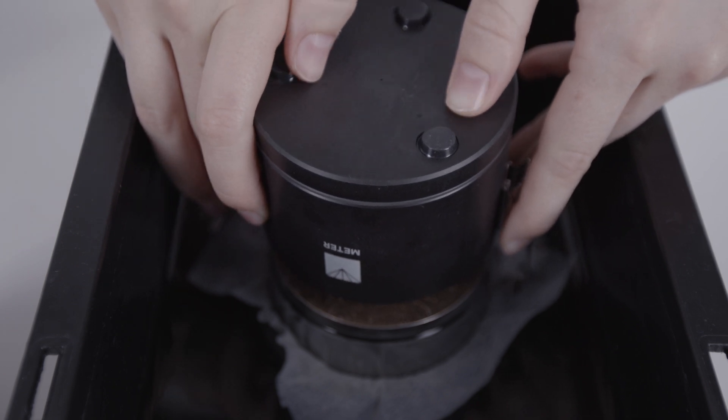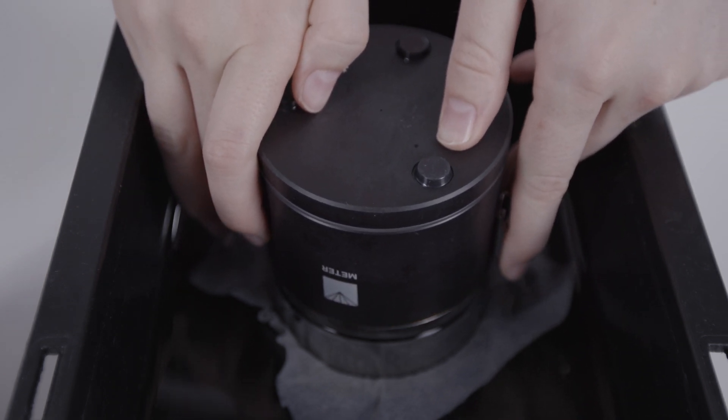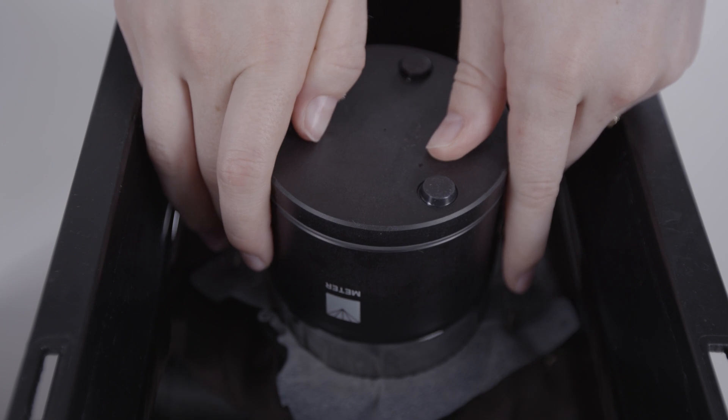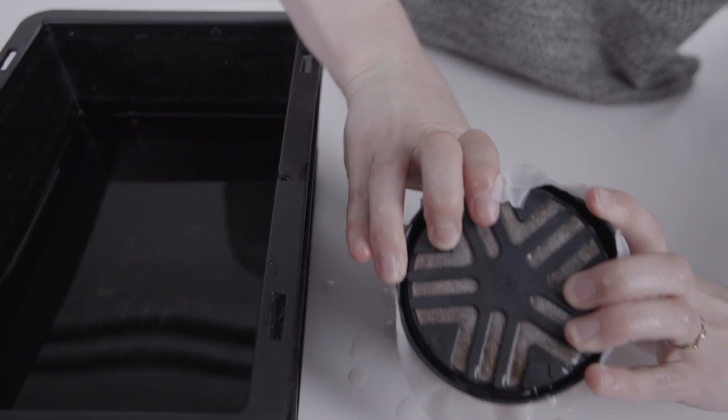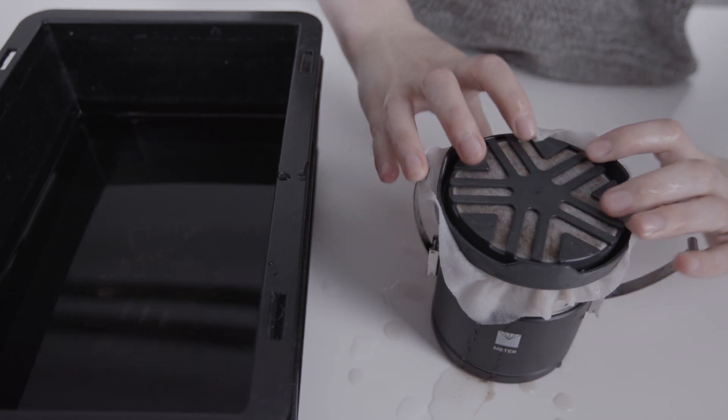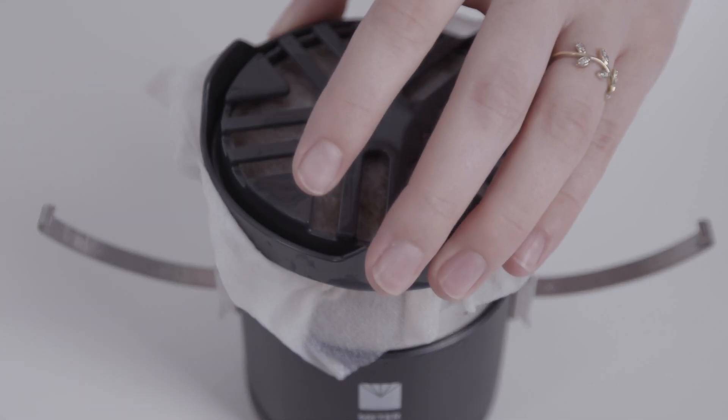Carefully place the sensor unit upside down onto the soil sample. Make sure no air gaps are introduced and the soil is not compacted. Turn the whole test assembly right side up. Remove the saturation plate and non-woven cloth.